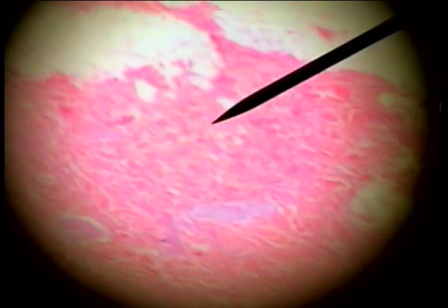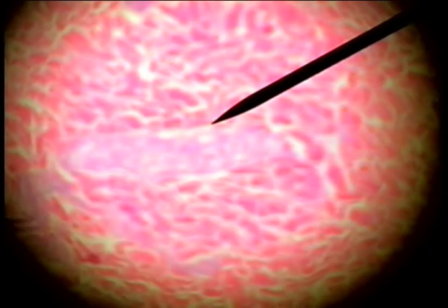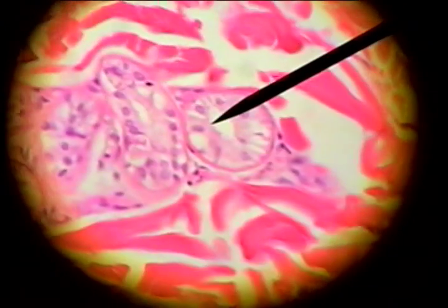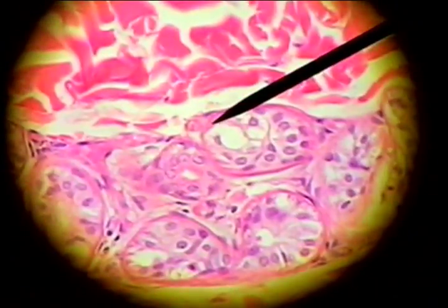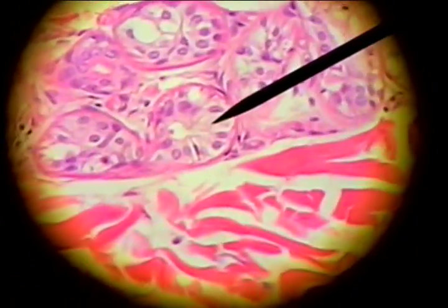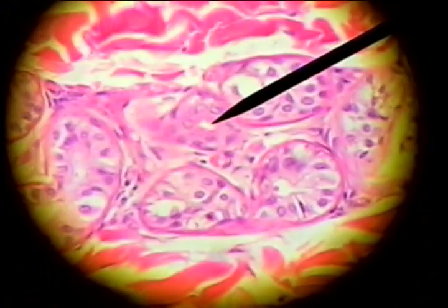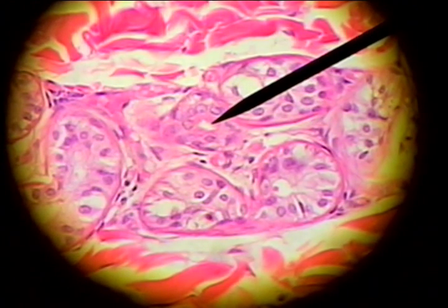If we further search in the dermis, we will find a sweat gland. It's characterized by the acini or clusters of glandular cells — cuboidal cells forming glands. Here's a sweat gland here, and another sweat gland here, and here's the duct, a little darker in color, with a lumen conducting the sweat to the surface of this thin skin tissue.